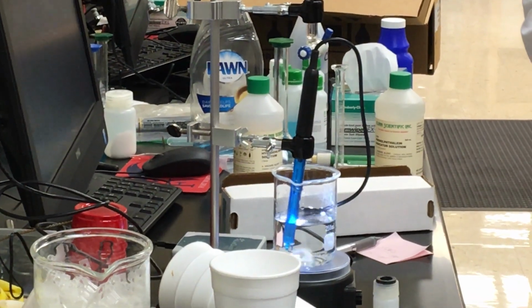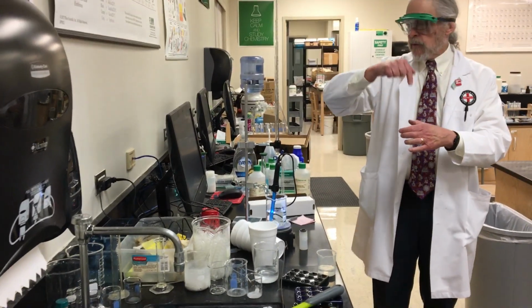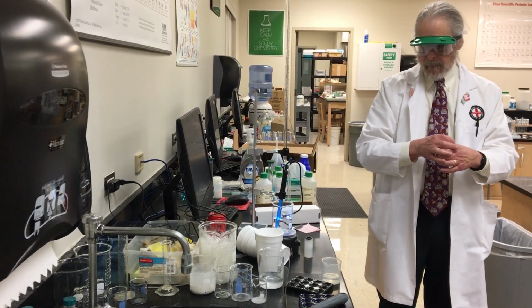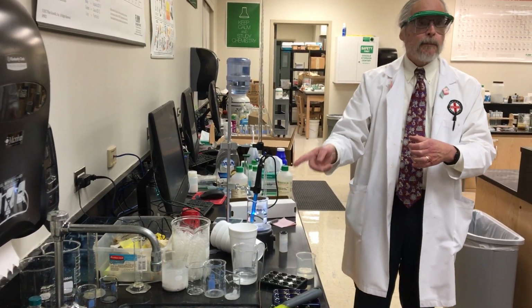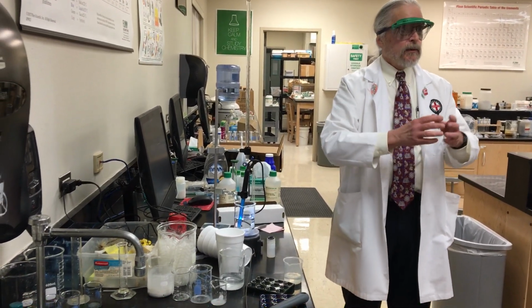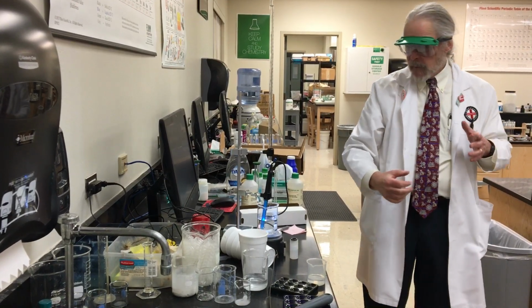What's going to happen now, think about what's happening here, is I have a drop of base falling into the acid, right? So where that drop hits, what's right there at that spot when the drop hits it? The base, because that's the drop that's falling, right? And the acid is all around it. Now, as this thing stirs, what's happening to that drop of base? It's getting mixed in. It's getting spread out. So aren't you having a really concentrated base that's falling and then spreading out?